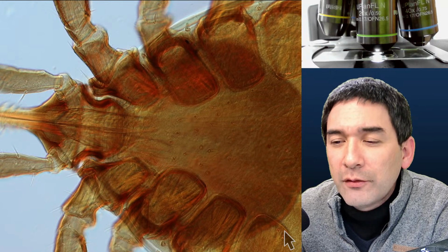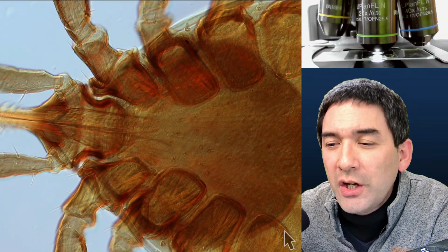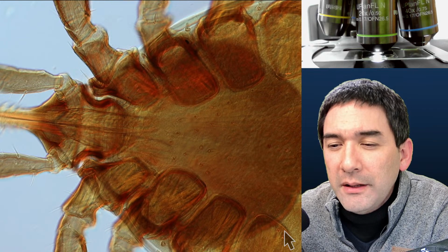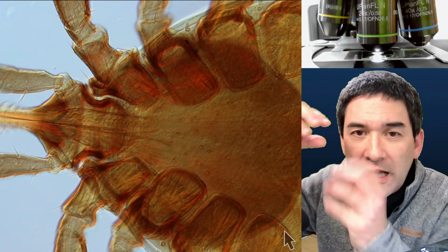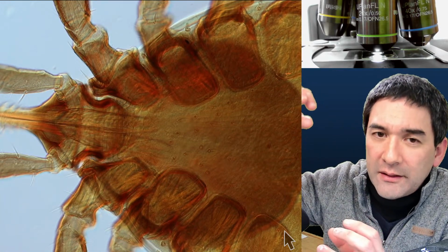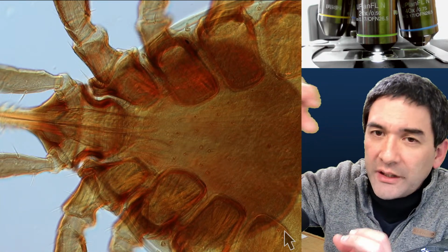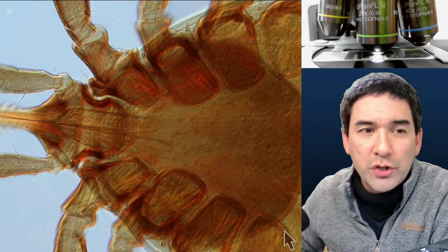I remember when we looked at the compound eyes, they seemed to be made of circles. Do you think they might be the eye cells? These are called ommatidia, the individual circles that you see. Actually, they're quite long. The compound eyes are long structures, right? Essentially what you see is only the outside part, and then these are kind of cone-shaped, arranged next to each other.